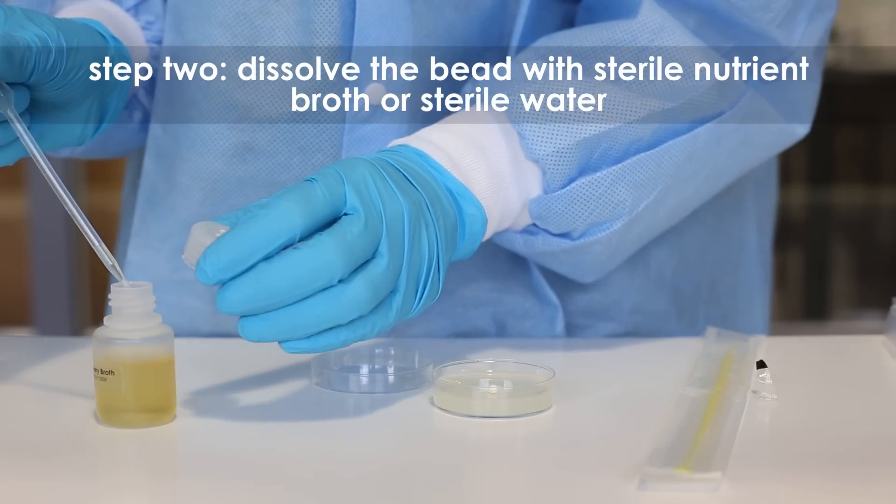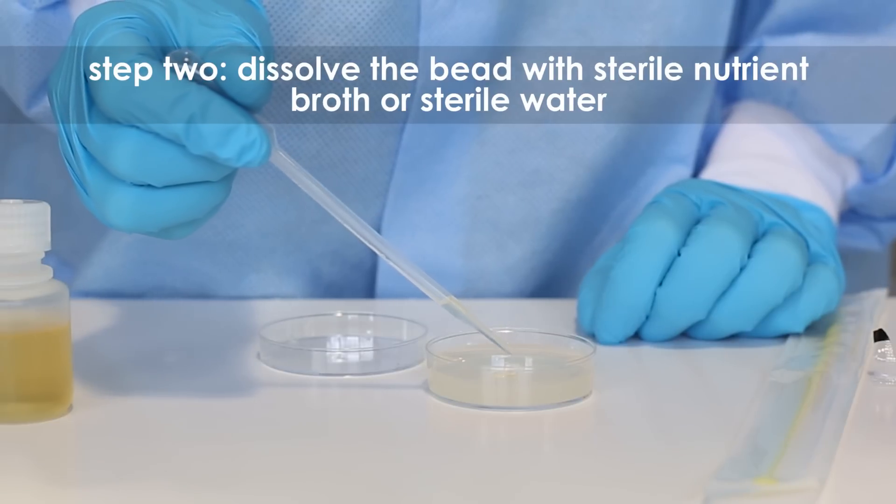Step 2: Dissolve the bead with a drop of sterile nutrient broth or sterile water.